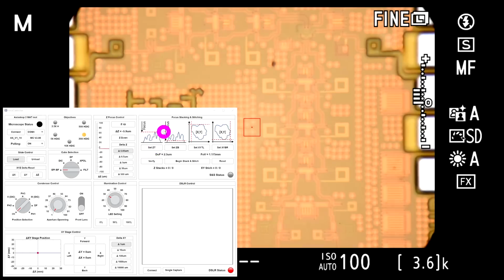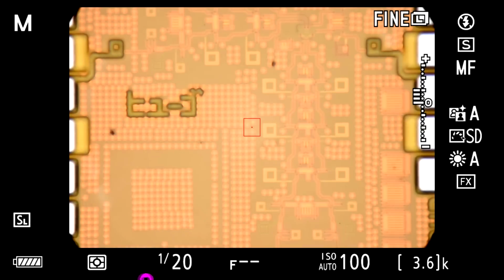When you switch that, it's going to bring a whole bunch of additional information on the screen that is used for image taking. There it is. So let me minimize that again. We are taking pictures at 1/20th of a second, which is good because we can capture a lot of light and our exposure looks good, and I'm using the highest settings of the camera that I can.